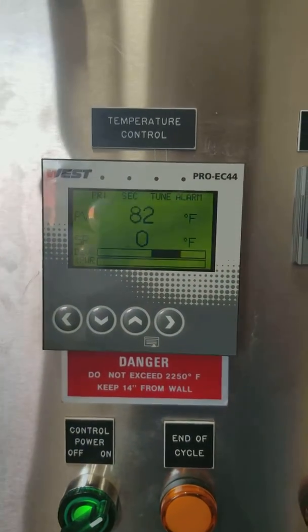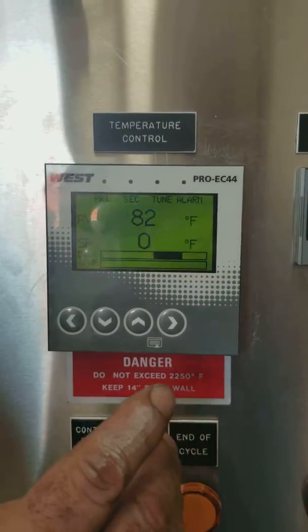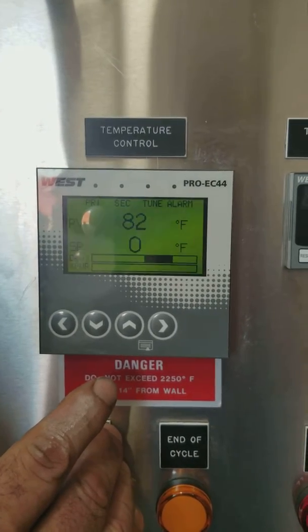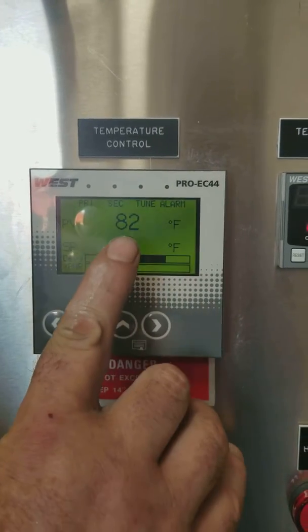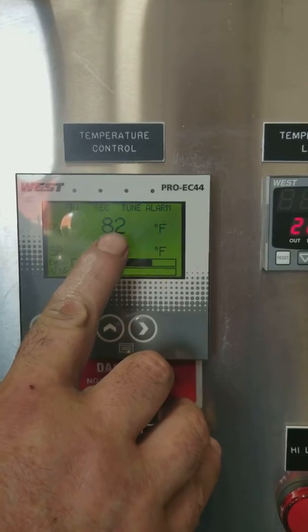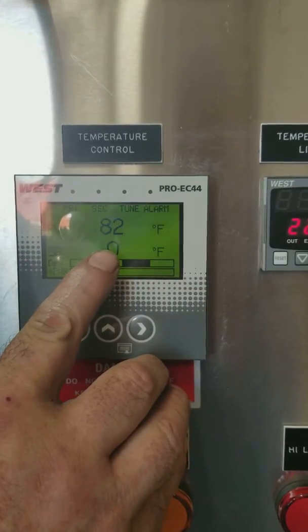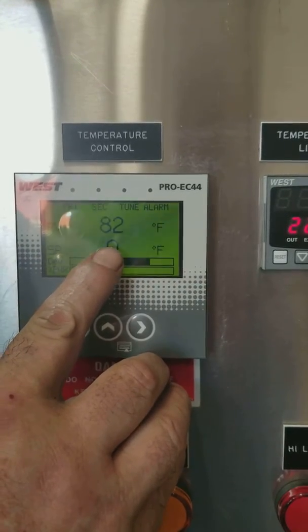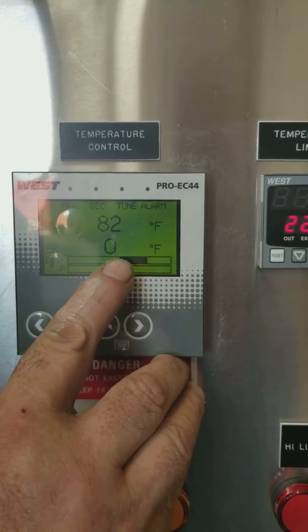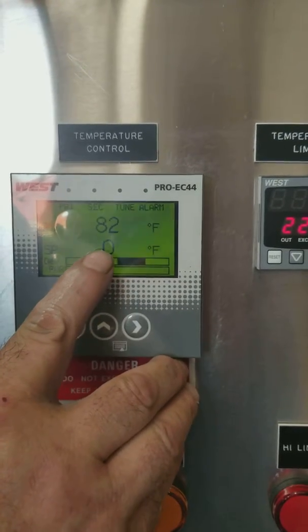This is your West Pro EC44. What you're seeing right now: the top is the ambient temperature of your chamber, the bottom would be the set point, and right below that is your deviation band.